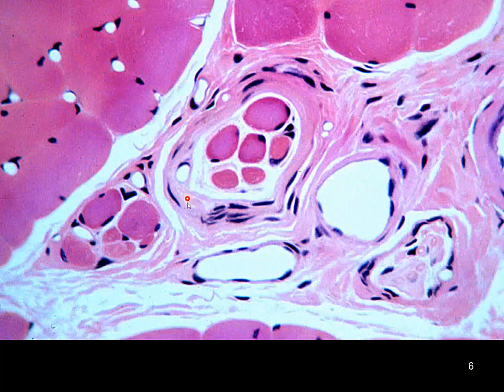But then all of a sudden we have this connective tissue and then what looks like muscle fibers inside this bundle of connective tissue, sort of isolated. These are our intrafusal muscle fibers, part of our muscle spindle apparatus. And here we have another over here as well. Again, the contractile fibers are extrafusal, and these are intrafusal. So this is our muscle spindle.